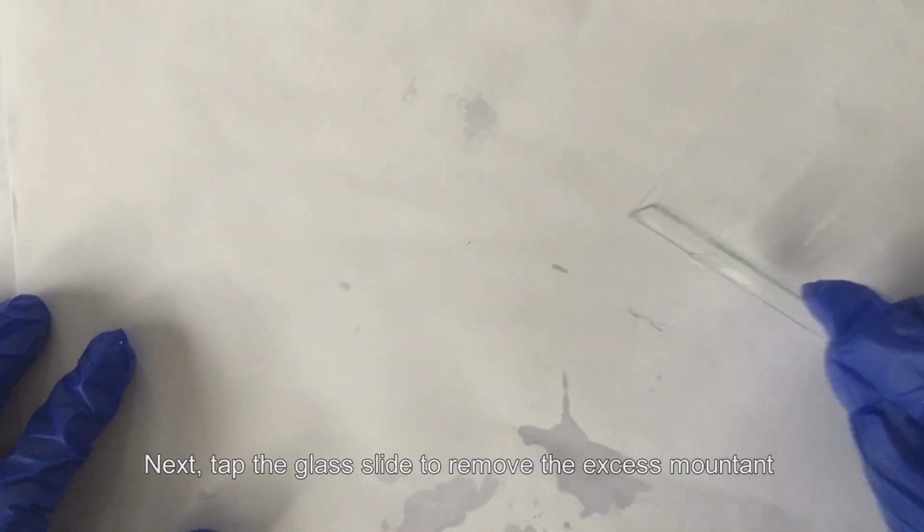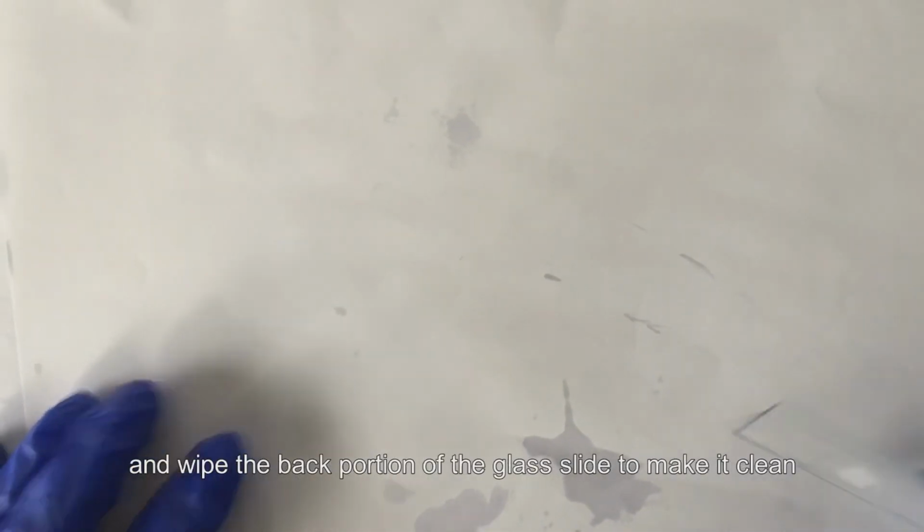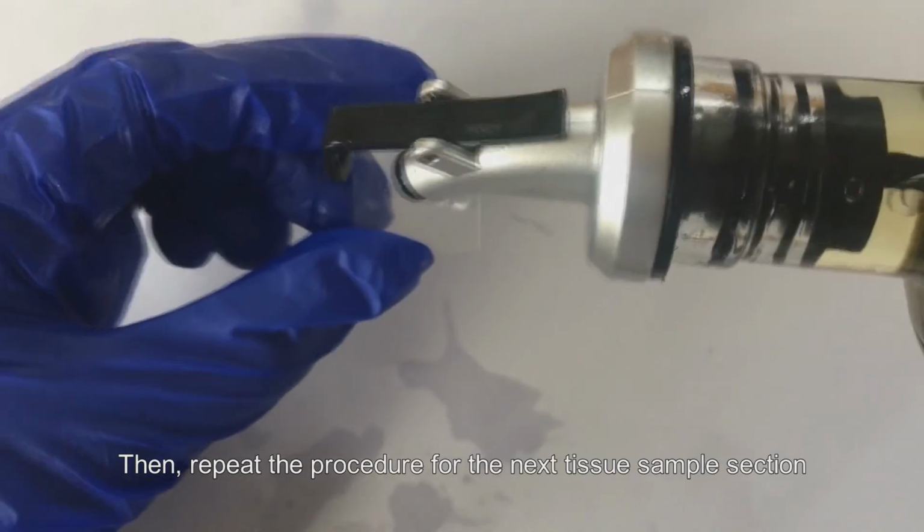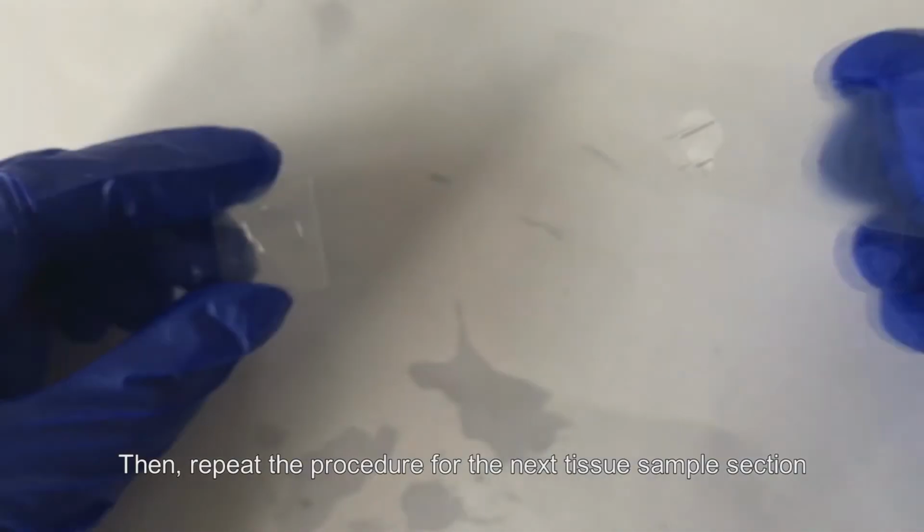Next, tap the glass slide to remove the excess mountant and wipe the back portion of the glass slide to make it clean. Then, repeat the procedure for the next tissue sample section.